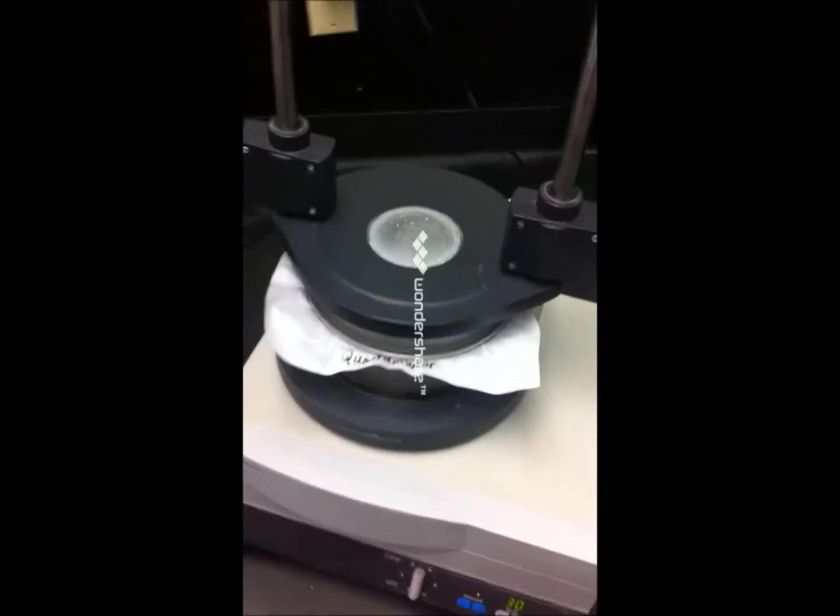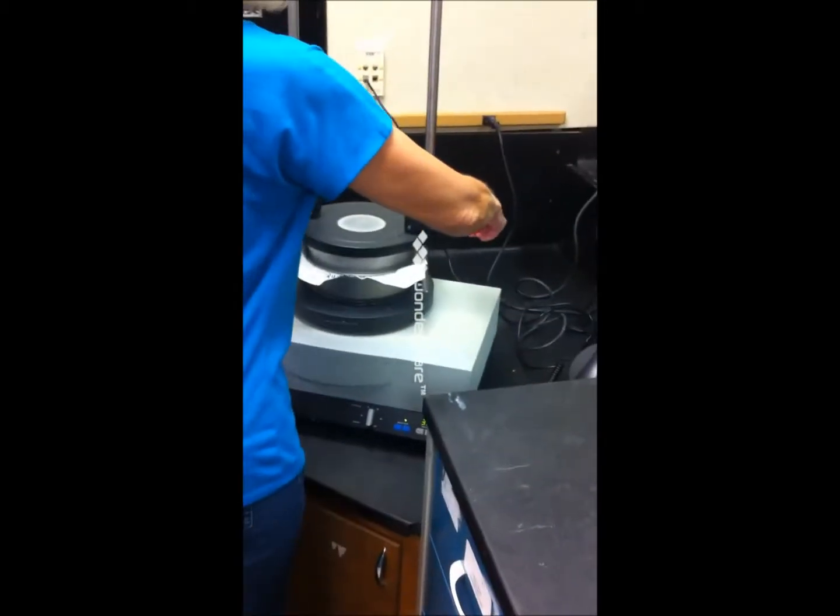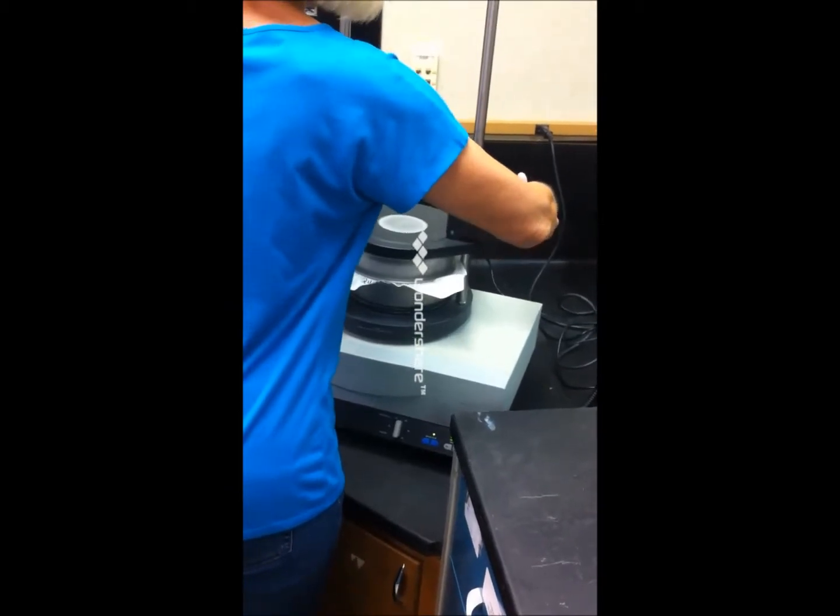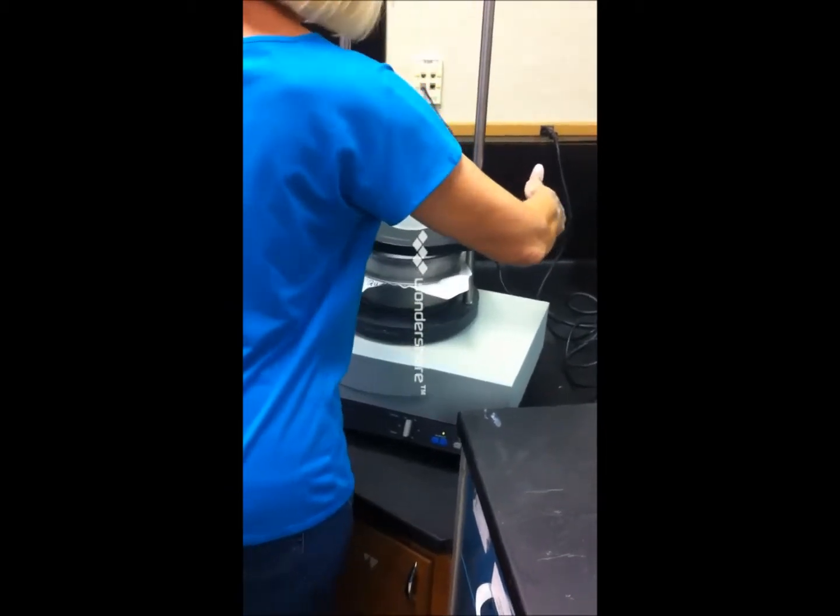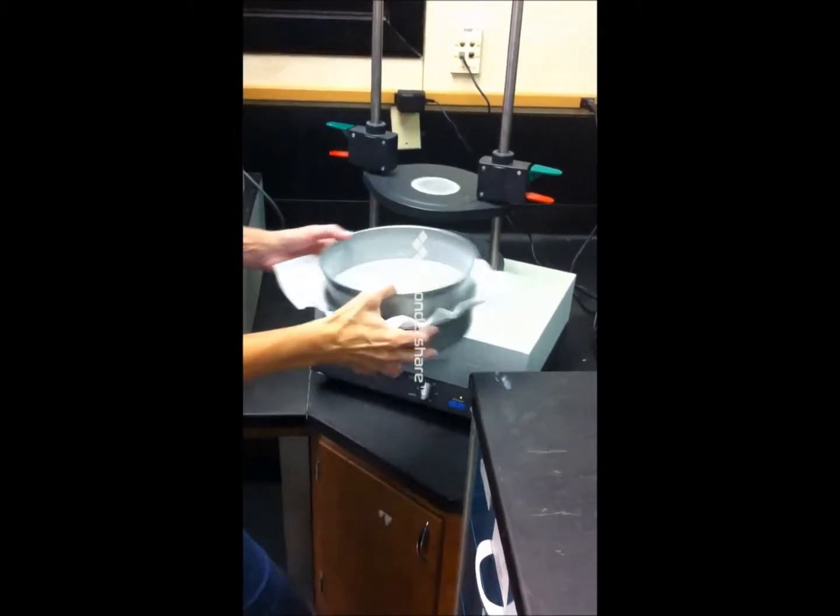The 30 minutes is over. Let's remove the quantum wear sample from the machine and see what type of particulate penetration was able to get through the quantum wear fabric.